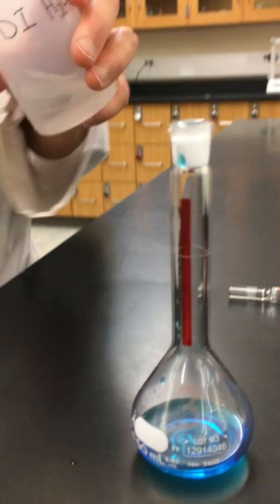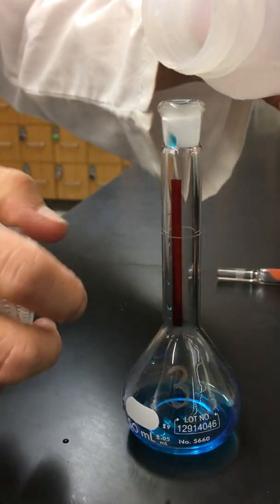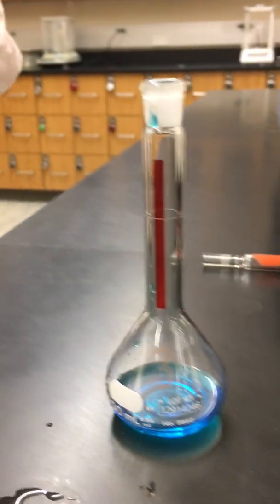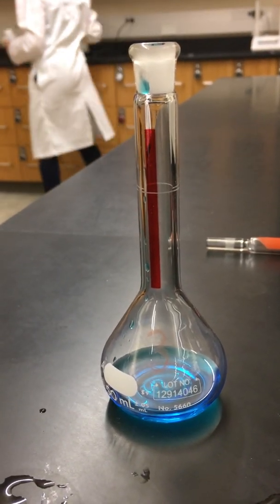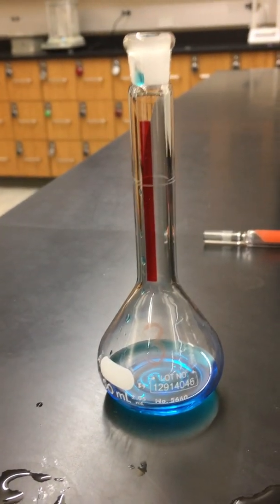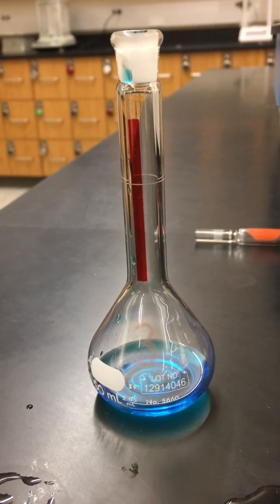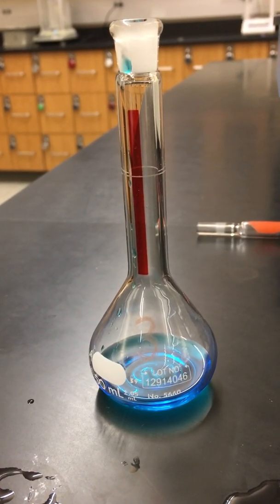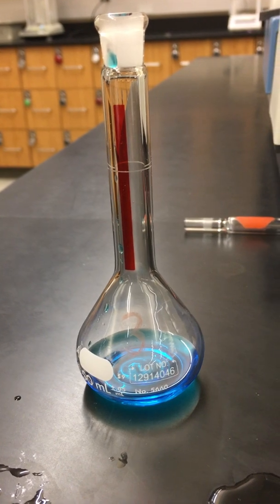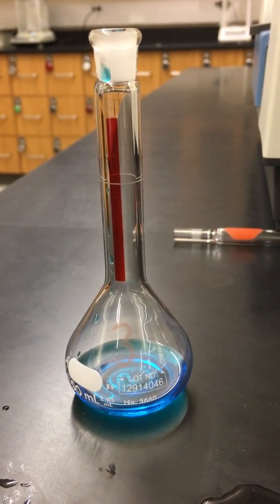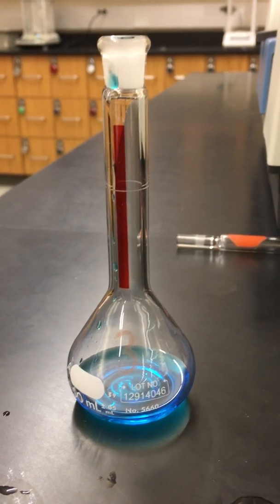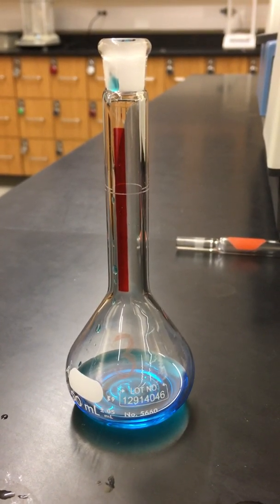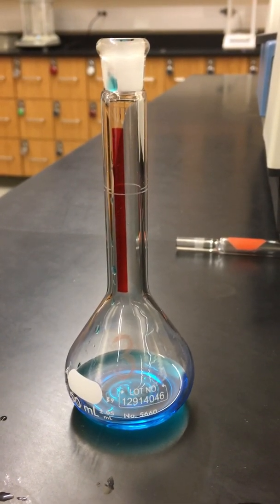So now we're ready to do our third one, which we're going to need more water. During this time out we would have a musical interlude but since we have no access to music or interlude you can just talk amongst yourselves as we refill our wash bottles.